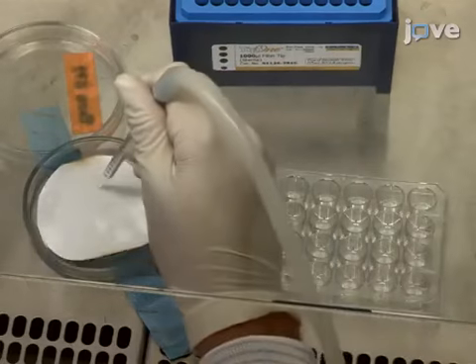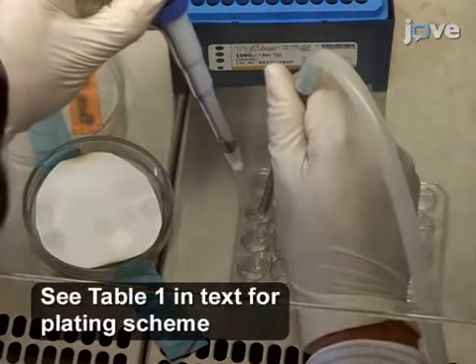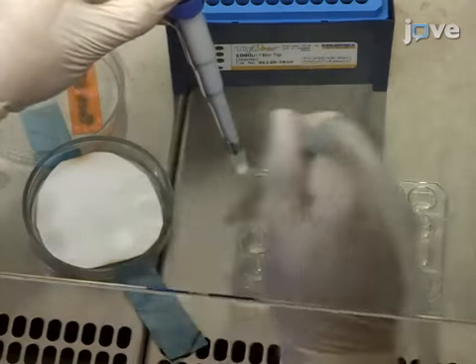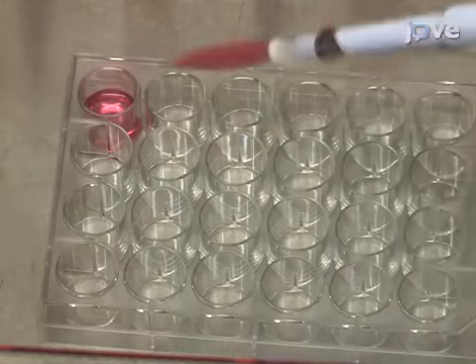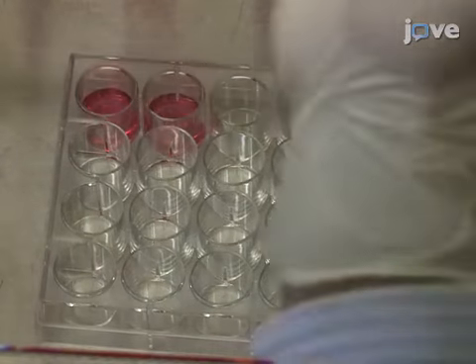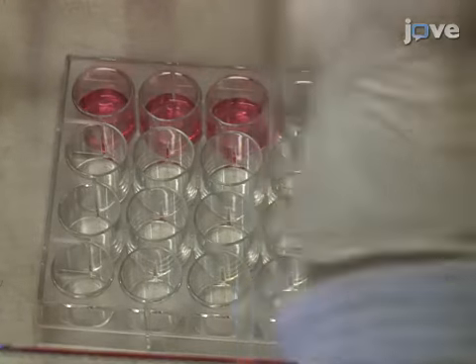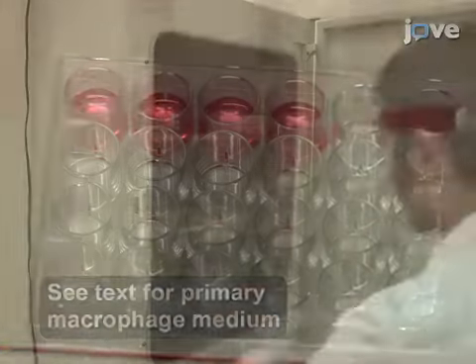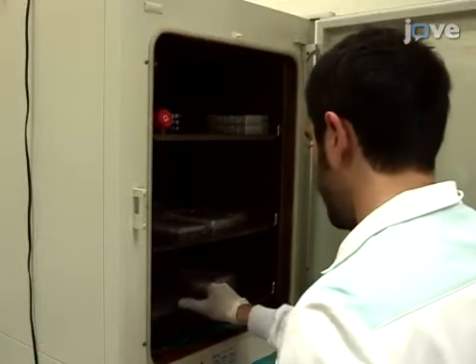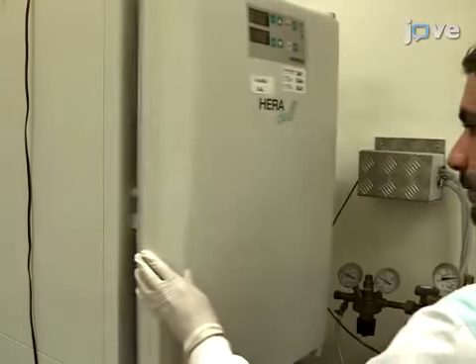To account for the individual conditions, add cover slips to the wells of a 24-well plate that will be used as controls. To plate the cells for infection, seed wild-type bone marrow-derived macrophages, or BMDMs, at a density of 0.125 million cells per well in 1 milliliter of primary macrophage medium. Then, incubate the cells overnight in an incubator at 37 degrees Celsius and 5% carbon dioxide.